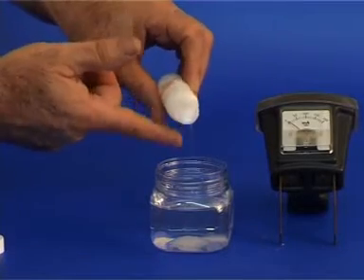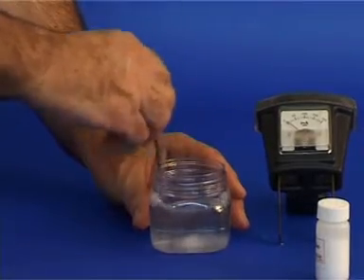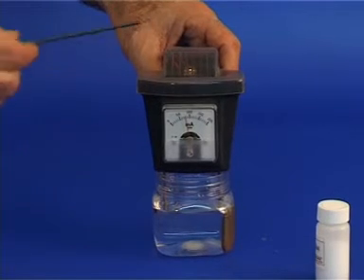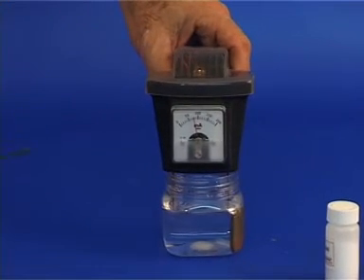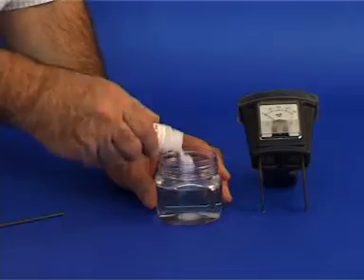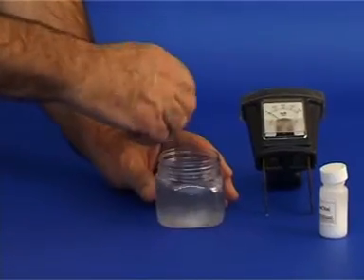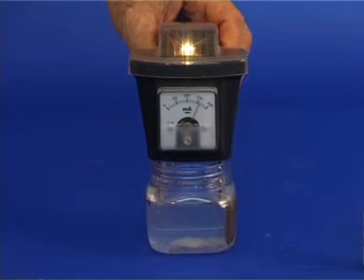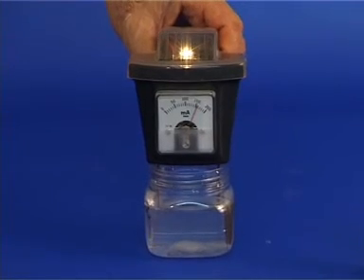Next, add a few grains of salt. Mix well and examine the conductivity. There is a very weak light from the bulb and the reading approaches the halfway mark on the scale. Now, add more salt, mix and examine the conductivity. The bulb shines brighter and the reading is close to the three-quarter mark on the scale.